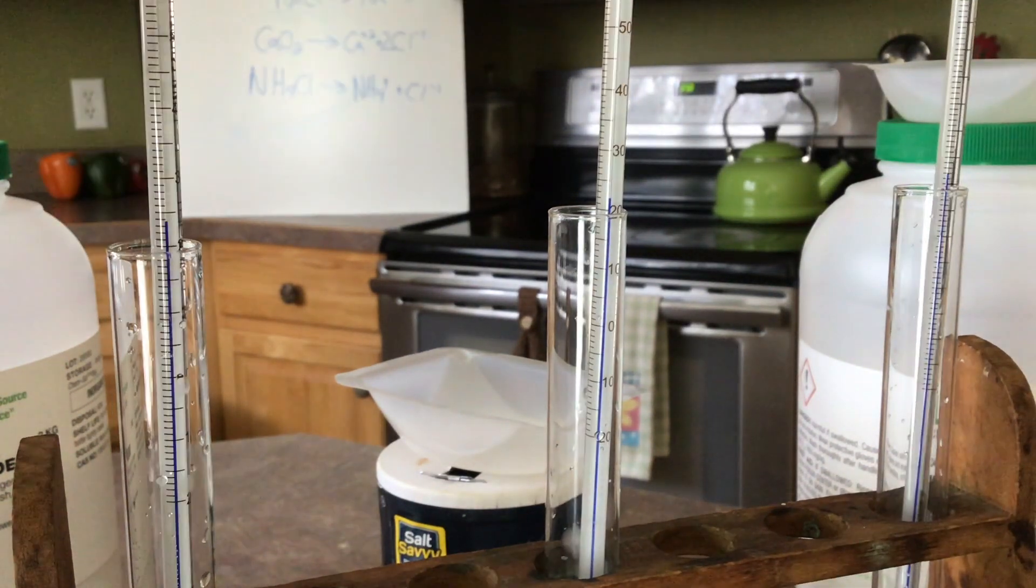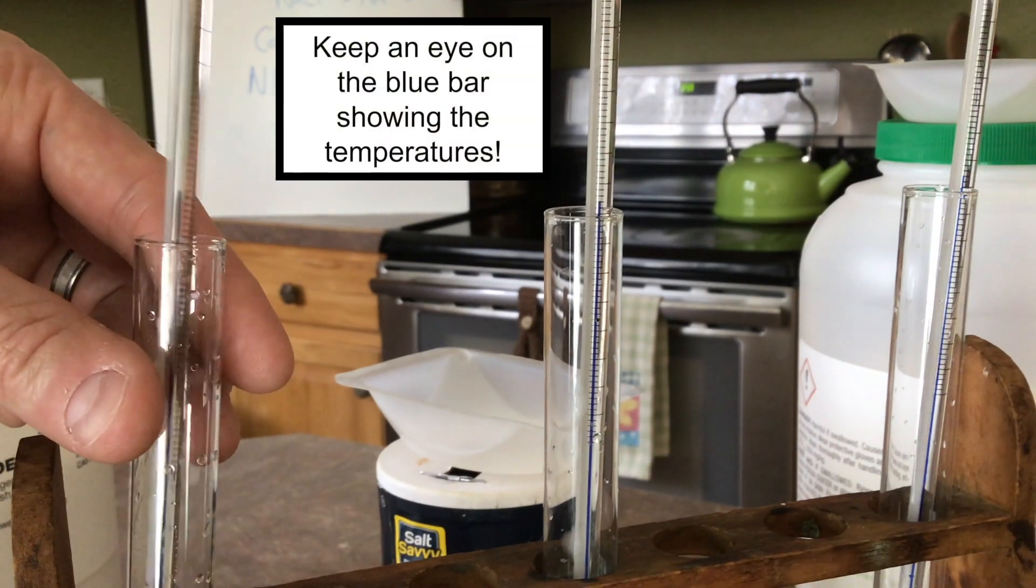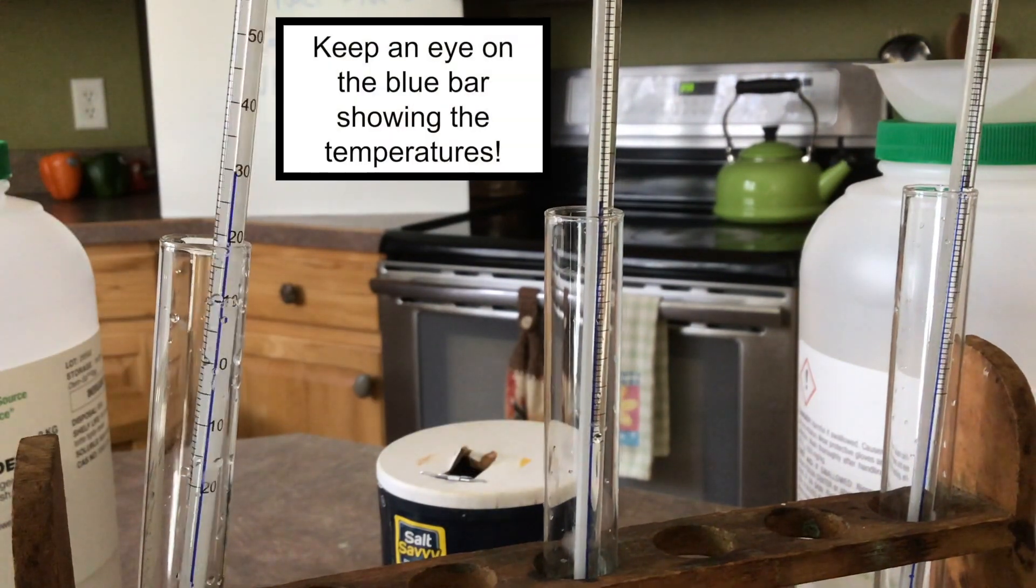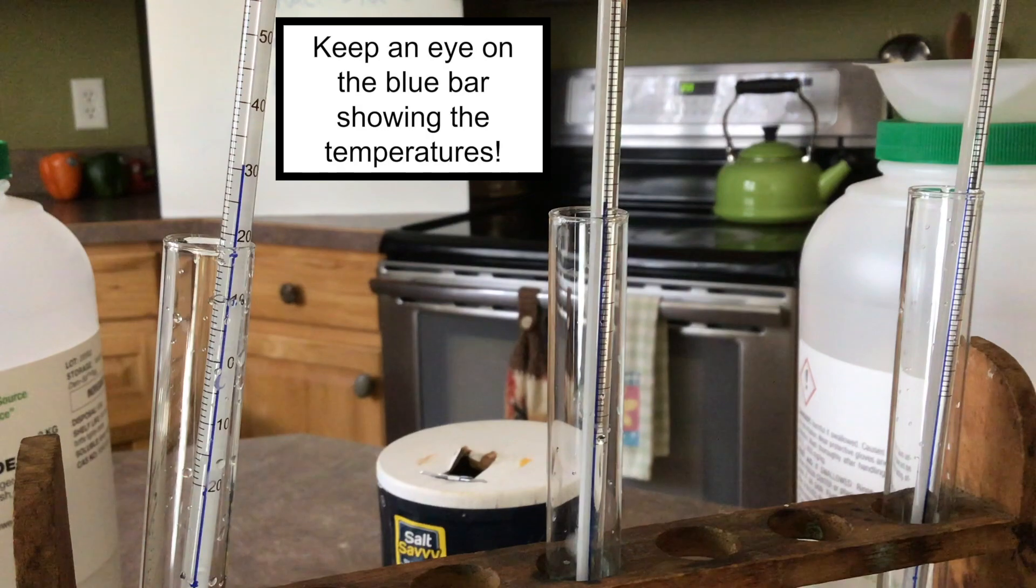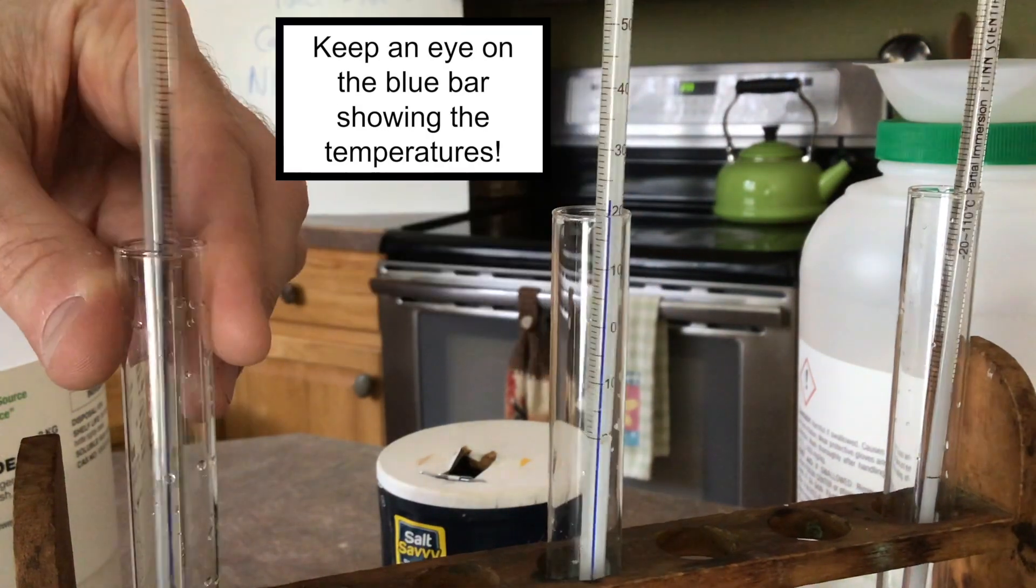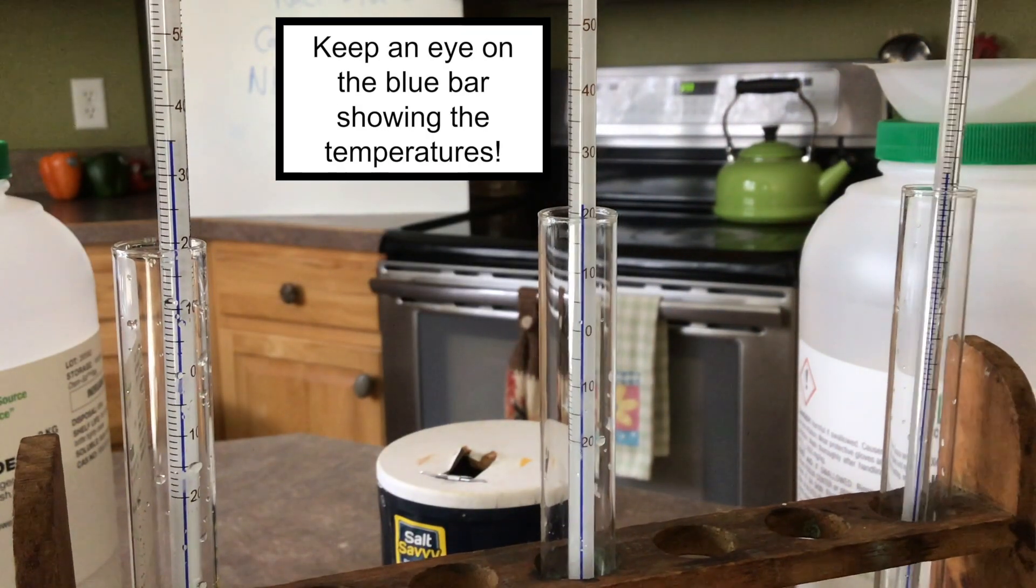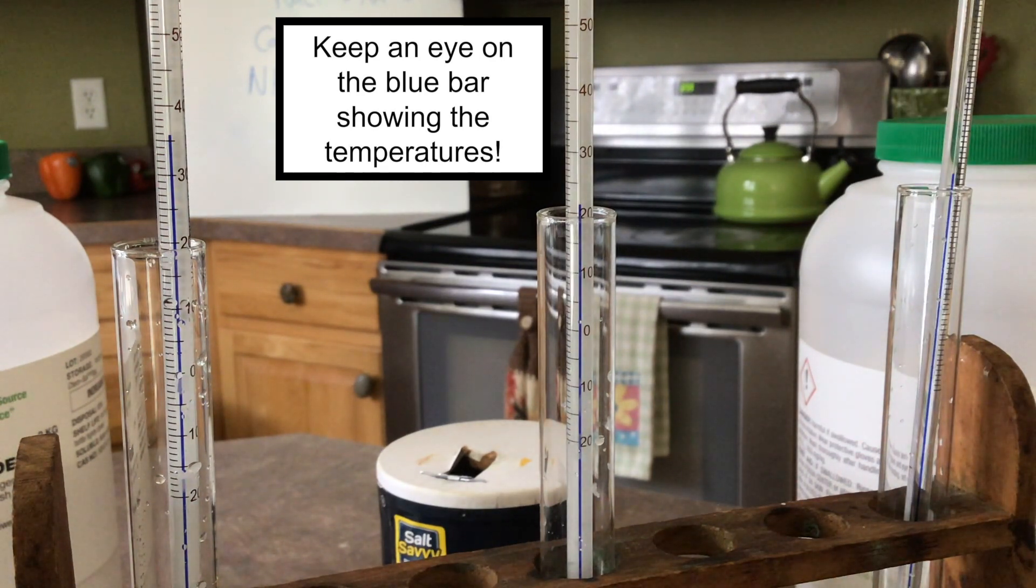We'll start with calcium chloride. Next, we'll go to the sodium chloride. And last but not least, let's go ahead and add the ammonium chloride salt.